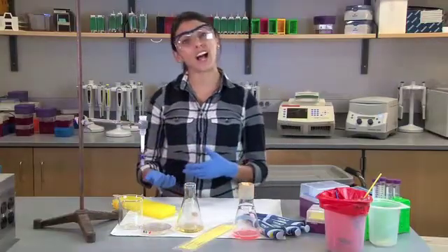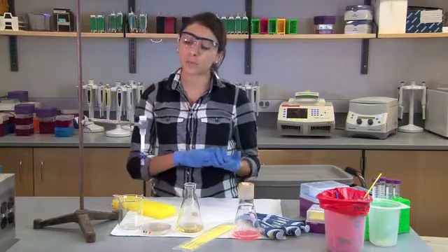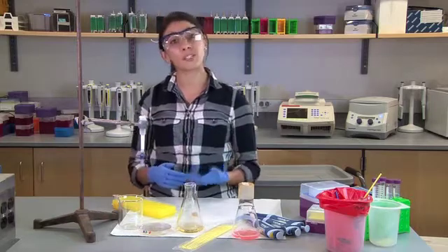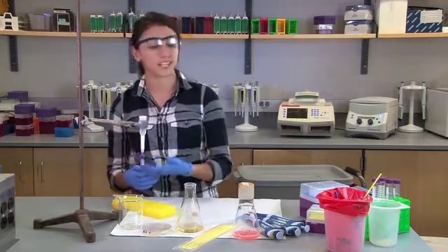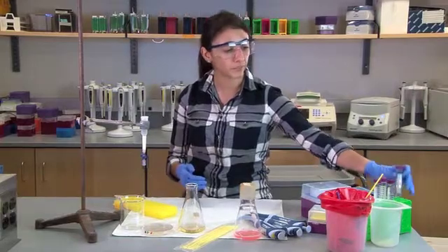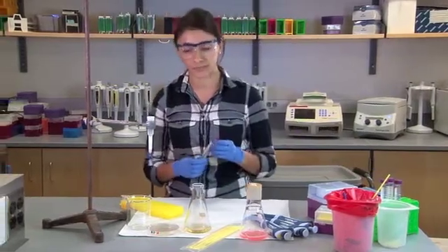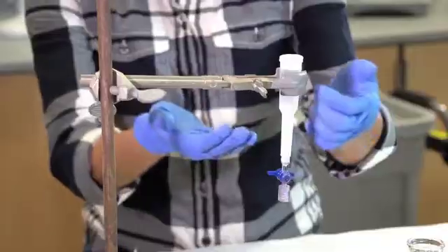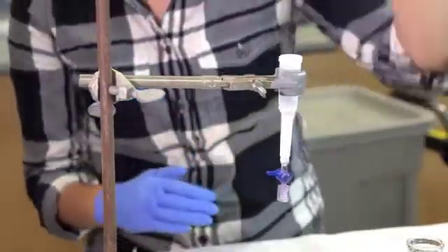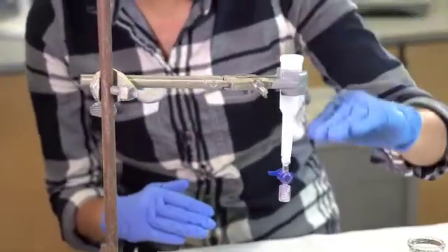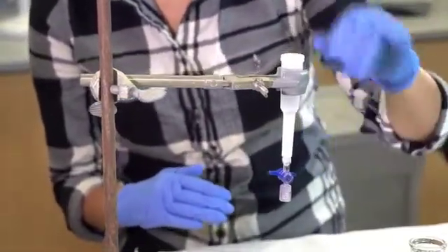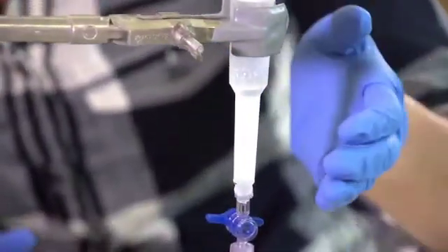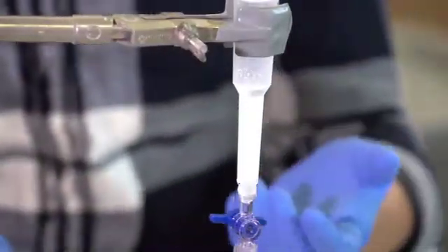You'll also see that we don't have a lot of liquid, but we have just enough to keep this column hydrated. If for some reason you receive columns that have tipped over during transport or they aren't hydrated, don't worry about it. So the first thing you want to do is rehydrate your columns and you could do so with using the CEB buffer that you'll receive. Secondly, you just want to make sure that you keep it upright. So as you can see my column right now is on a ring stand. The resin beads have settled and they're pretty packed, but you can see there's about one to two millimeters of buffer at the top to keep this hydrated. This column is ready to go for lab six.